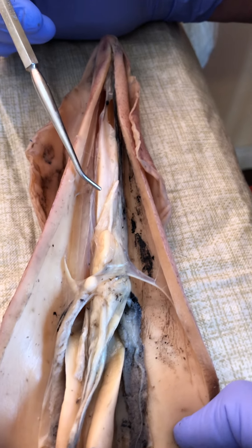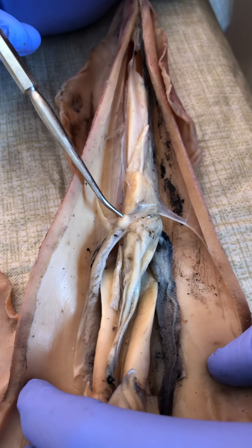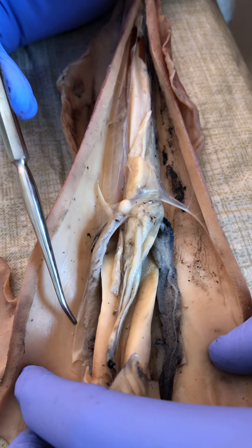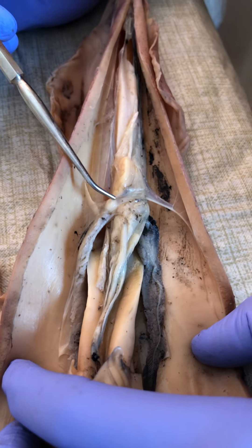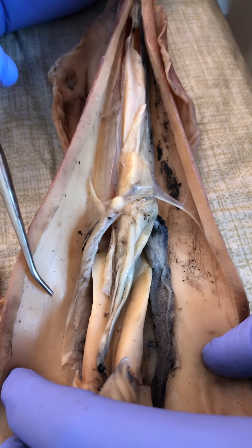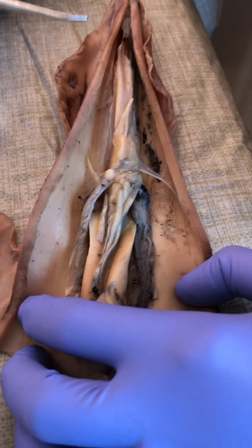And then, look at this — beautiful — that little knob, and then ventral to it is a gill. So remember, this was one of the hearts, right? That was a branchial heart going through a gill. So that's the end of the squid assignment. Thank you.